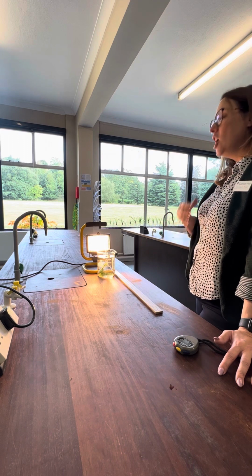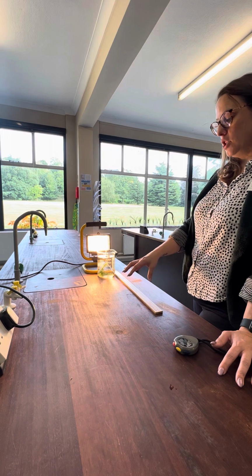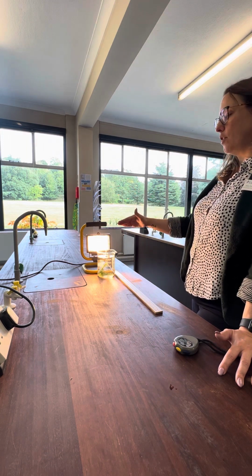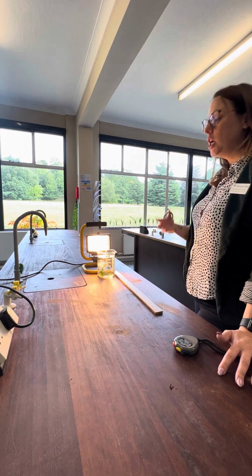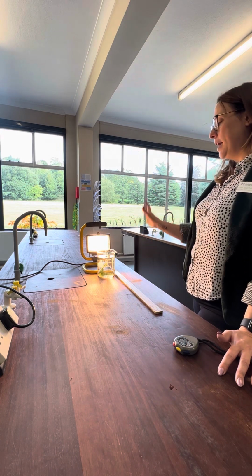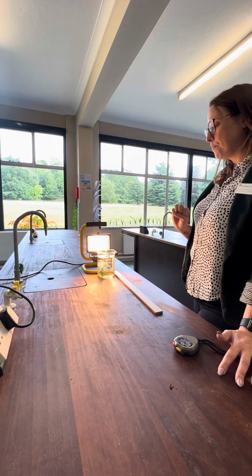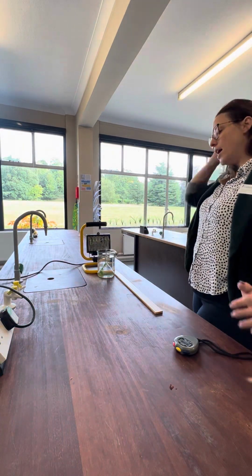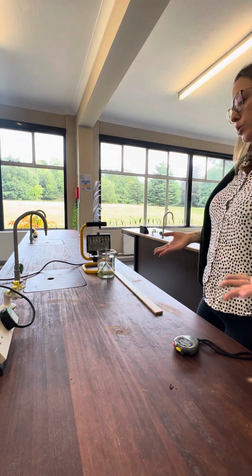Because it could be that you're not going to see any bubbles if you start timing straight away after you've moved it. The plant needs time to adjust its rate of photosynthesis to the levels of light for you to actually see any change. So that's quite important. So we would leave it for 5 minutes to adjust to those conditions. Let's turn the light off for that. Then I would time for a minute, count the number of bubbles and make a record.